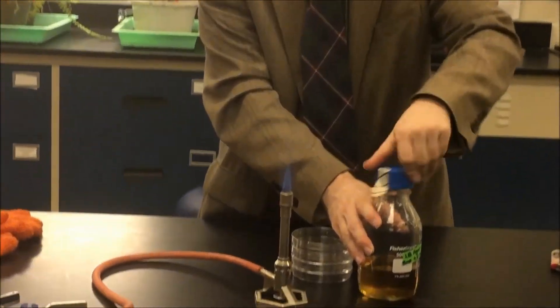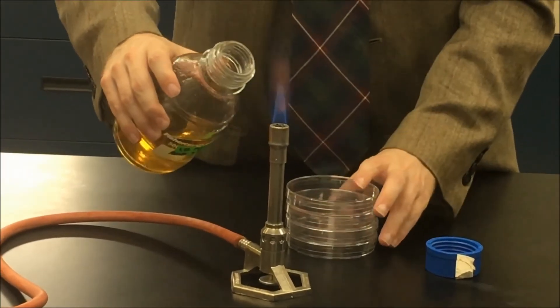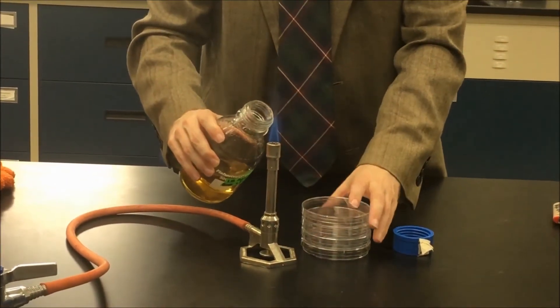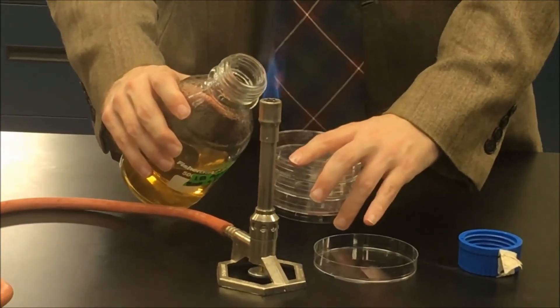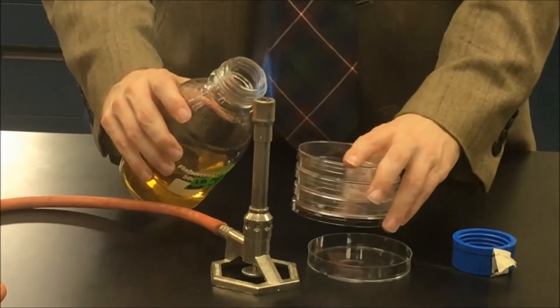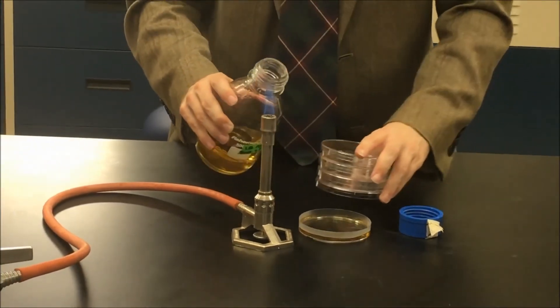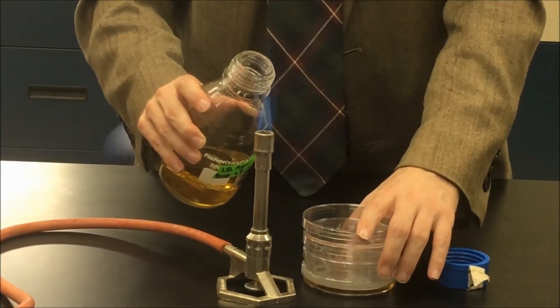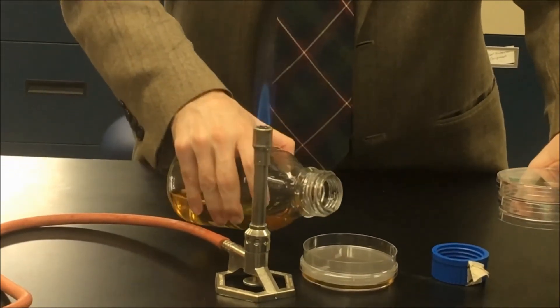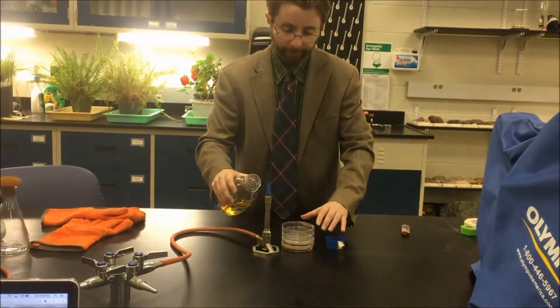I'm going to uncap the flask and flame the lip to make sure it is sterile. Taking my sterile Petri dishes in this stack, I'm going to lift up all of them except for the bottom plate while holding the lid to that bottom plate. I then pour in some media just until it covers the bottom, and then replace the pile. I then grab the lid of the second-to-bottom plate, lift up, pour, and replace the pile. Every now and again, I'm going to flame the lip again and then continue pouring.